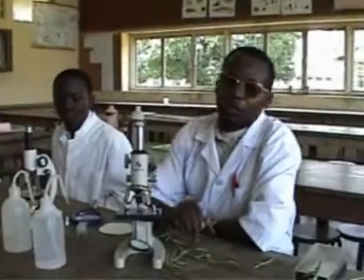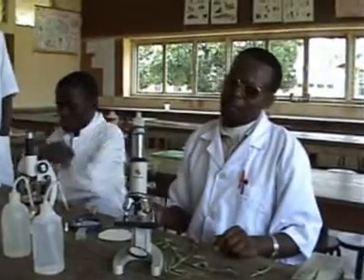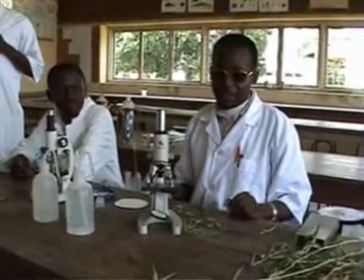The next part of practicals is microscopy. Because as we are observing organisms, some organisms are placed under a slide and they could be already prepared slides which are preserved, or the candidate can be asked to prepare the slides themselves.